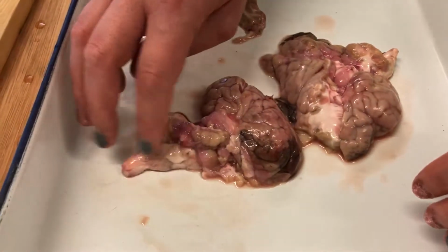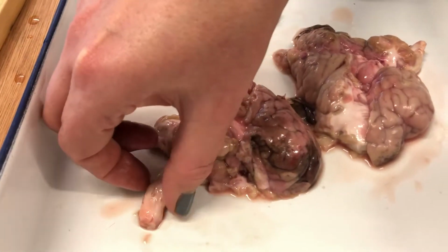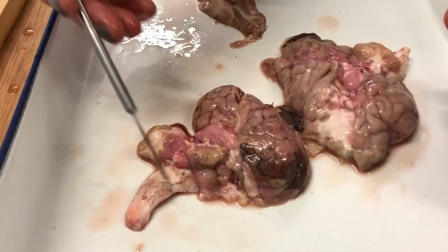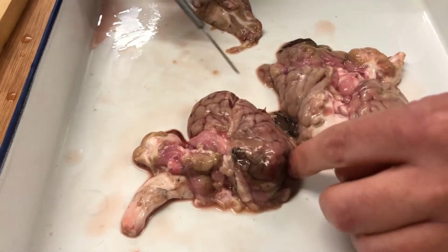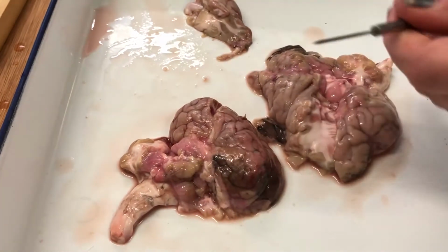However, what we can see is a good example here of the pons, the medulla, and the reticular formation. That's your brainstem and the top of your spinal cord, this meaty bit here. And then this is half of a brain. So our brain is split into hemispheres, and you can see the central fissure just here.